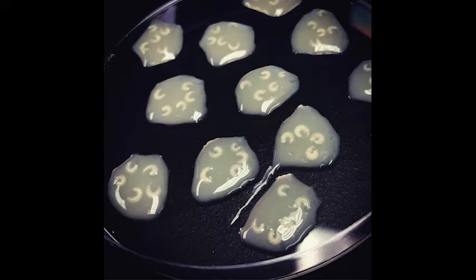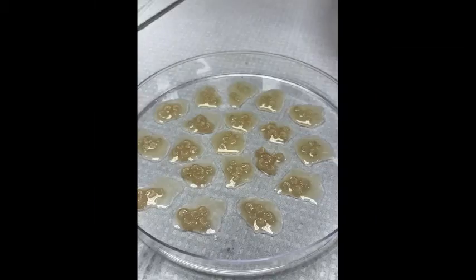Another example where this is an experiment where we're rearing them in a really huge blob of food, basically one giant blob instead of many small blobs. But you can see how well they seem to do. You can have problems with rampant infection in there. But we've done a pretty good job of keeping these clean.